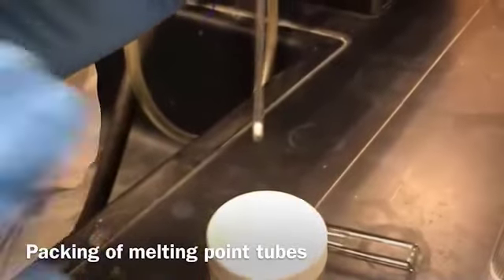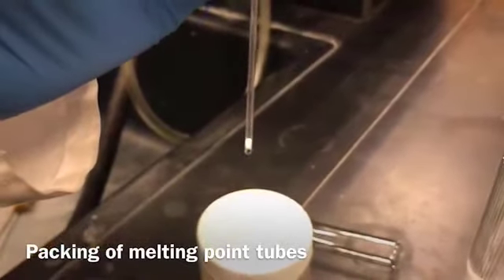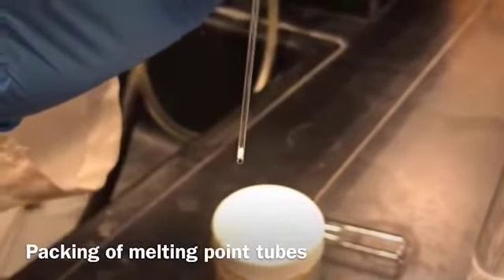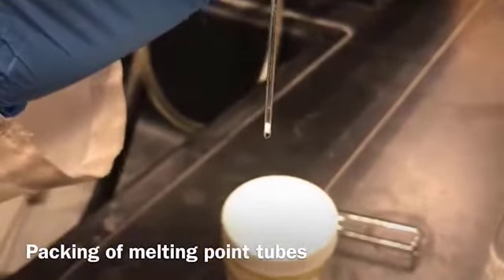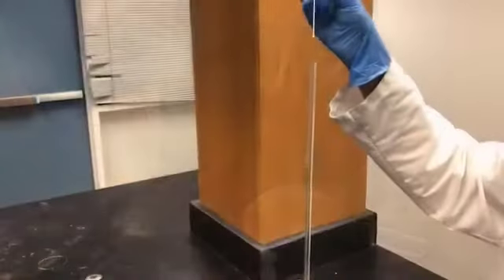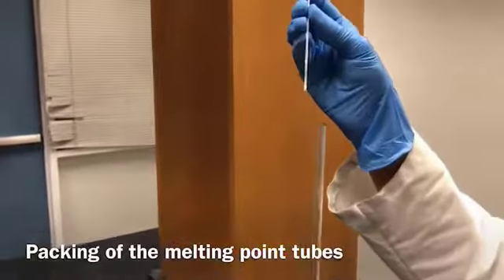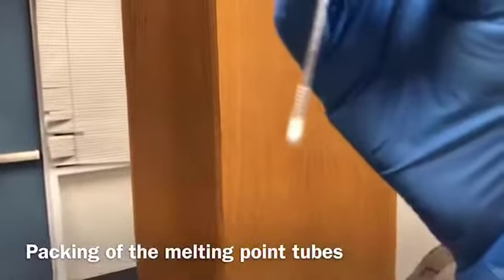The height of the sample should be between 1 millimeter to 2 millimeter, not more than that. If you pack too much, you will not get the correct melting point. So this is my capillary tube. It has the impure sulfanilamide, right?